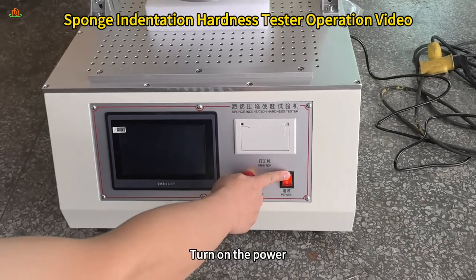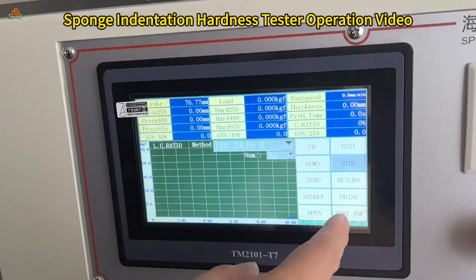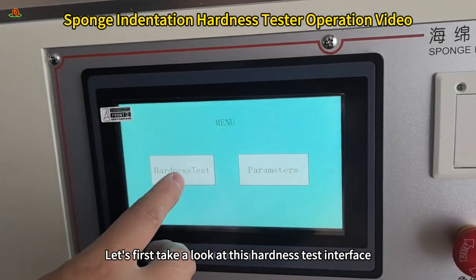Turn on the power. This is the hardness test interface. This is the parameter setting interface. Let's first take a look at this hardness test interface.